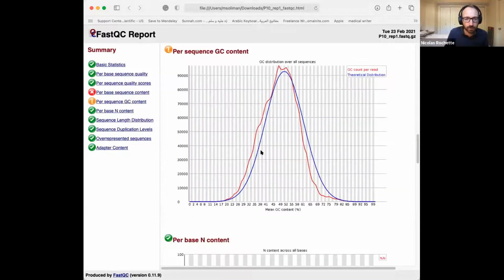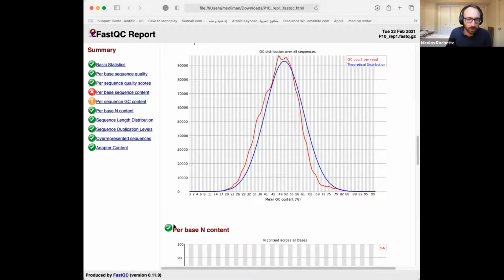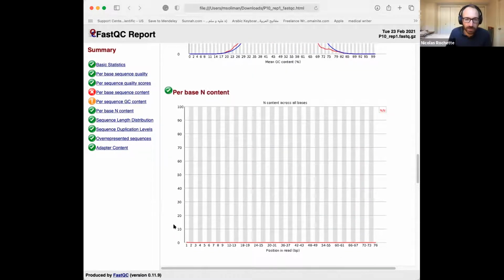And the next one is the Ns. Sometimes the Illumina sequencer, instead of writing A, T, G, or C in a read, just writes an N. Usually they're not very abundant. If they're very abundant, something went wrong with the sequencing.